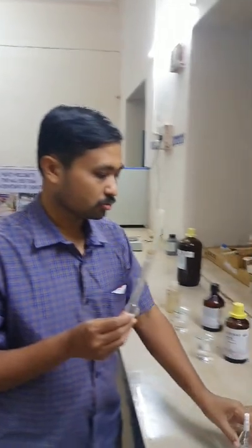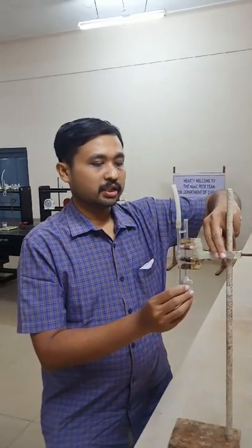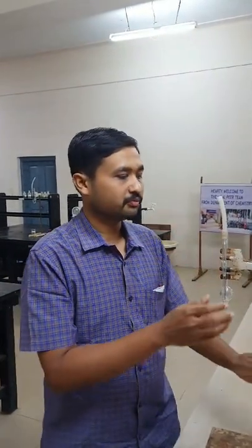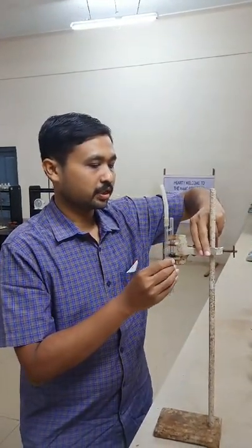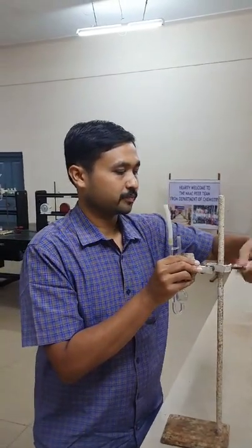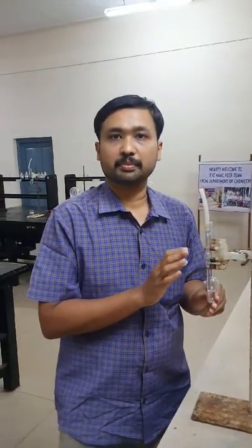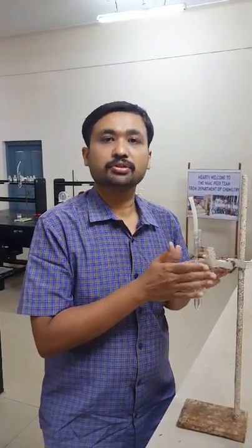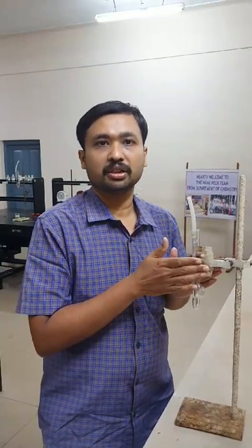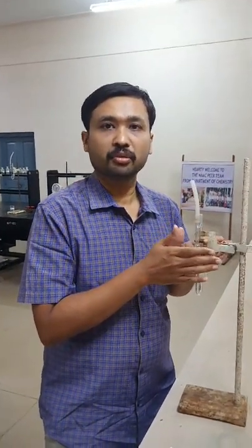First, you have to mount the viscometer on the burette stand and adjust the height as per your convenience. I will reduce the height of the viscometer so that it is at my convenience. Please make sure that once you fix the height of the viscometer, do not change it during the experiment — keep the height uniform throughout.